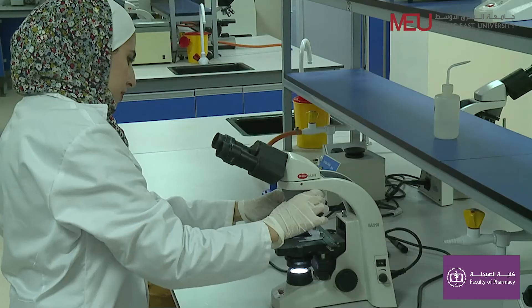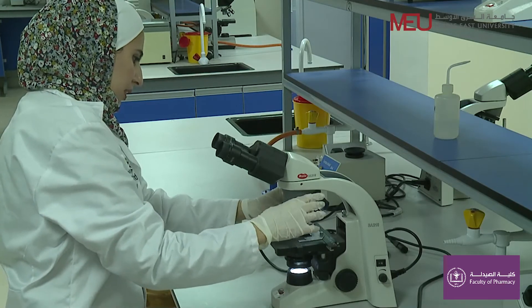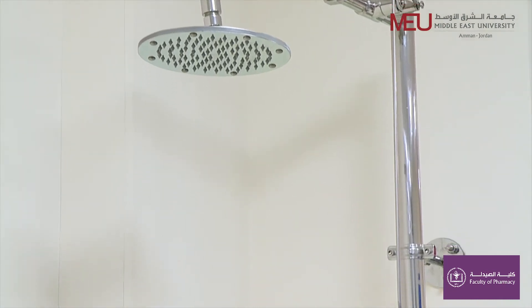In case of an accident, please inform the instructor. We also have the following safety tools in the lab.